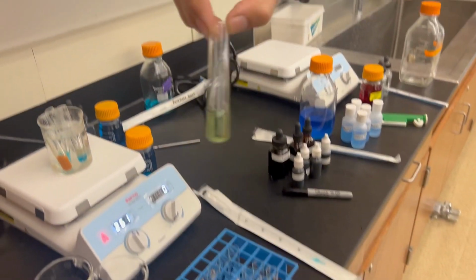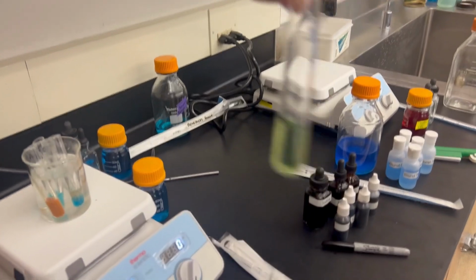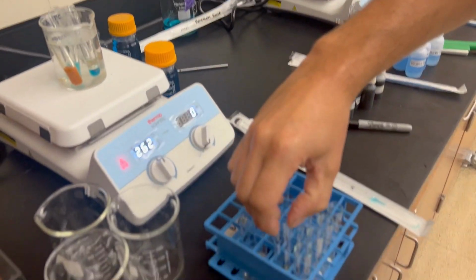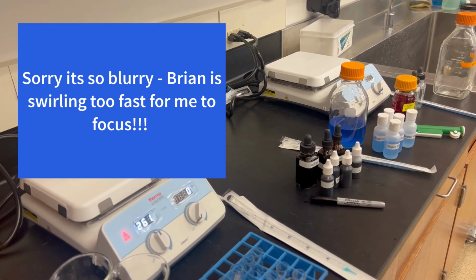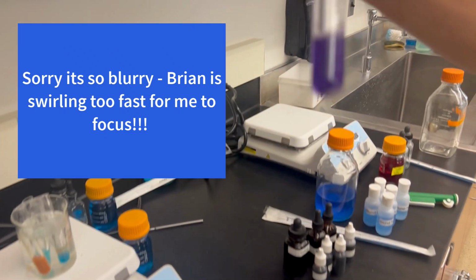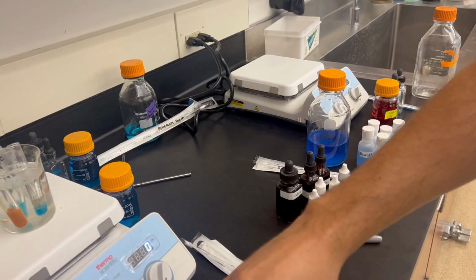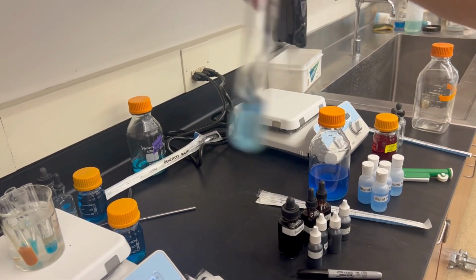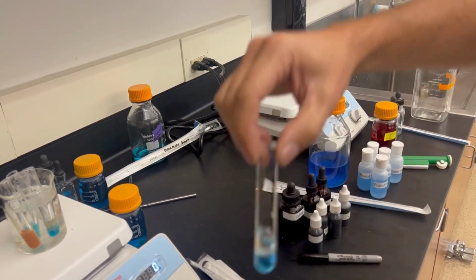Again, swirl. We're looking for color change. This will test for presence or absence of amino acids. So this one's B. This is B. This is C. And D.